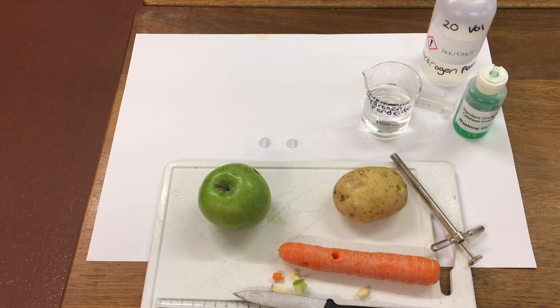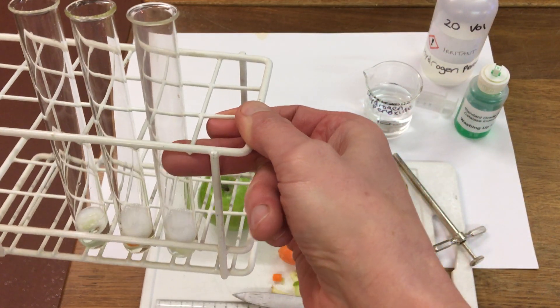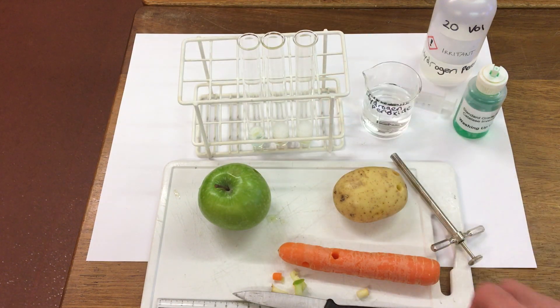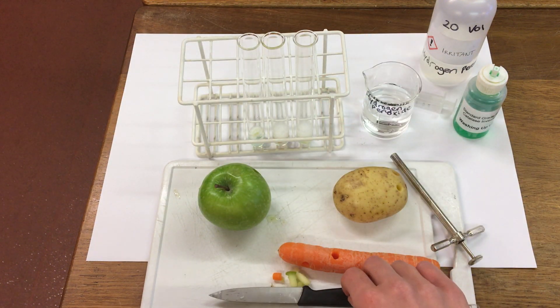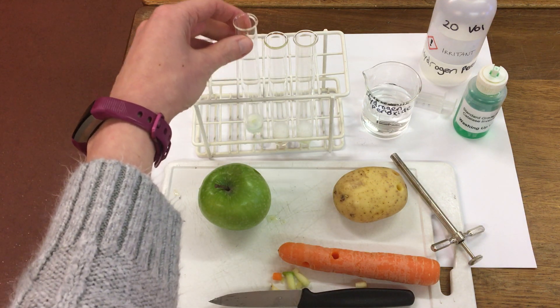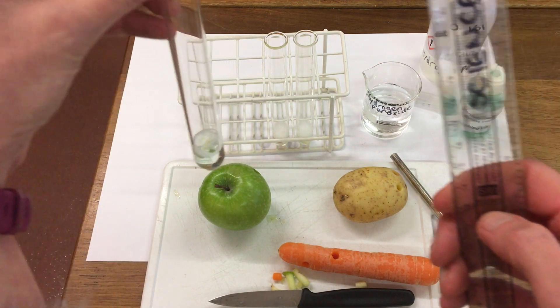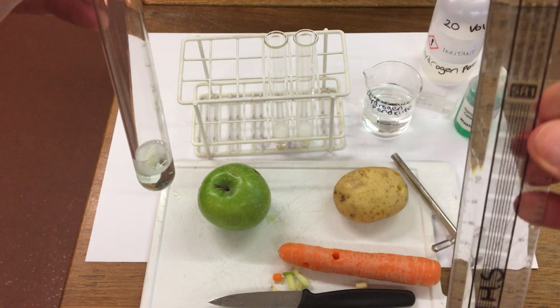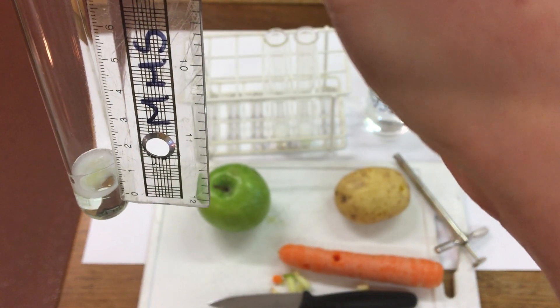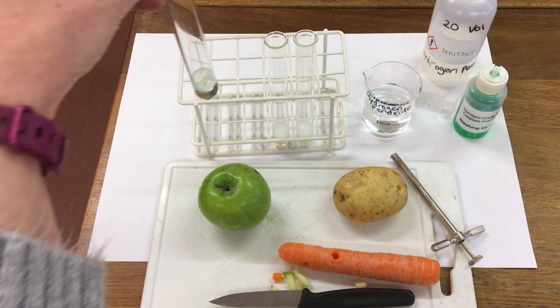So after 10 minutes, we can see we've got some foam produced in our test tubes. So we can use our ruler to measure. The enzyme catalase is present in some vegetables and it's speeded up our reaction. So in our first one - this one was apple - we can measure we've got 0.6 cm of foam in there.